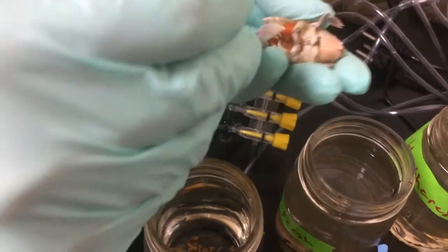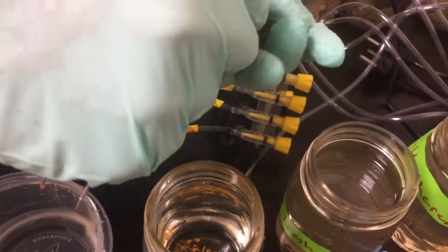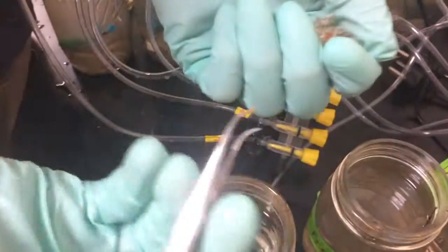It looks like it's trying to hit me. Wait, it's soft? Yeah, it should be soft. Eggs.